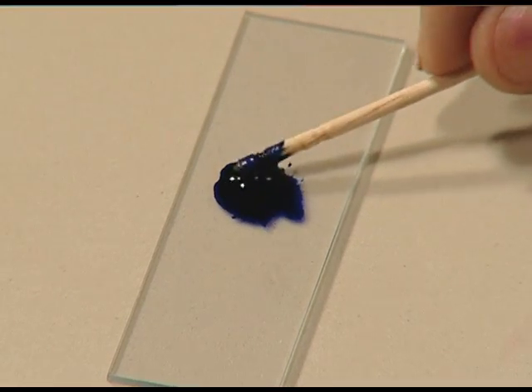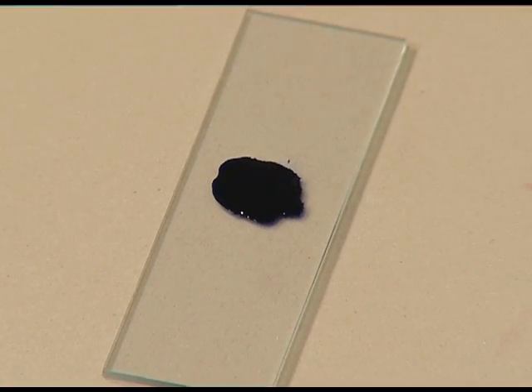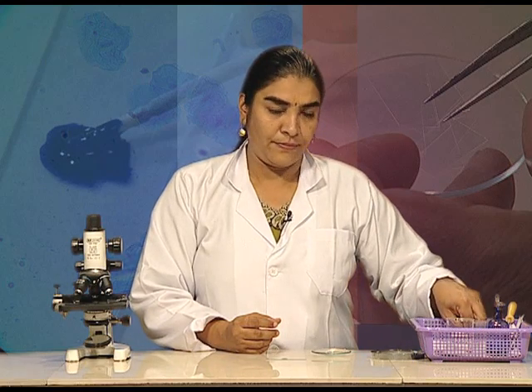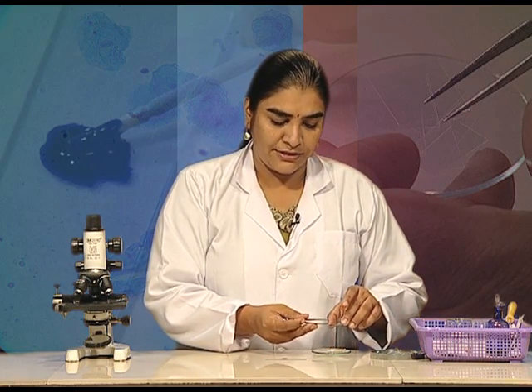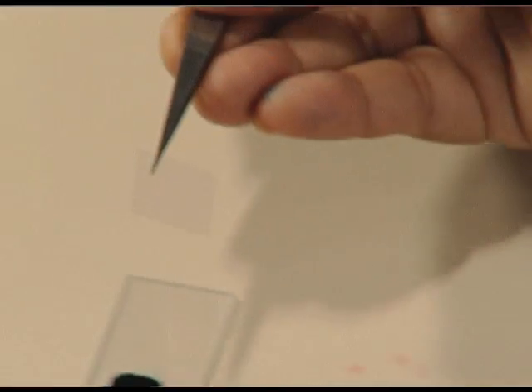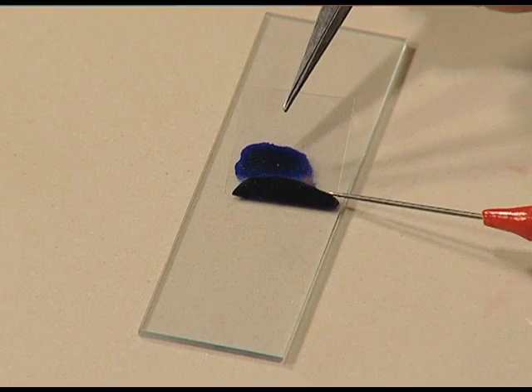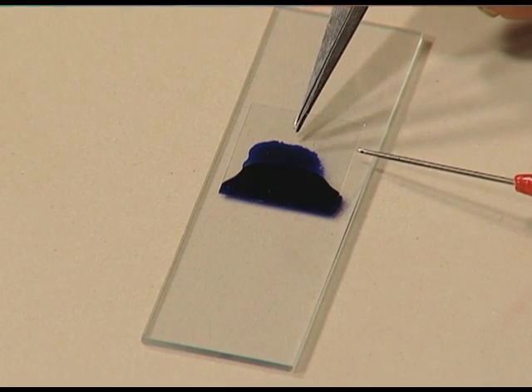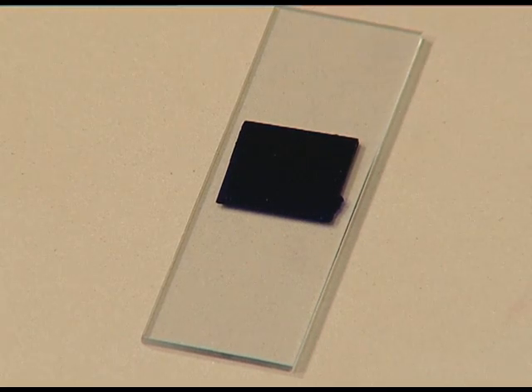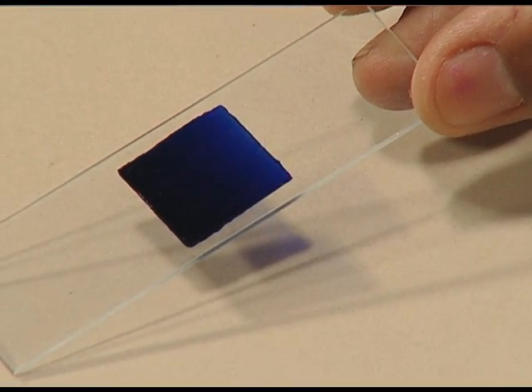Spread the material throughout the slide. Please throw the used toothpick in the dustbin — it cannot be used again. Now, with the help of a forcep and needle, gently place a cover slip onto the material that has been mounted on the slide. Place it very slowly so that there are no air bubbles in the slide.